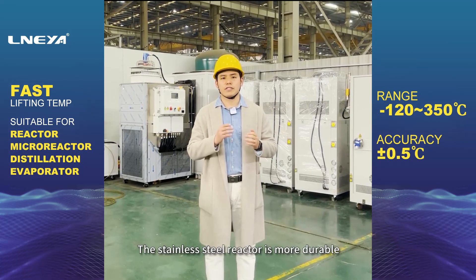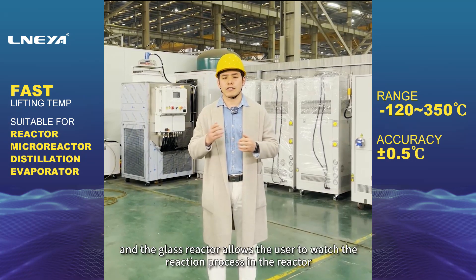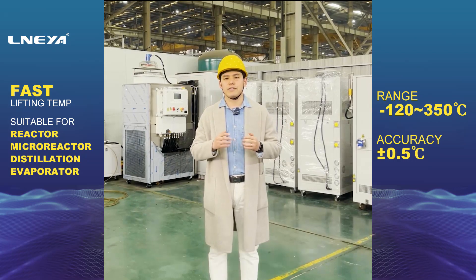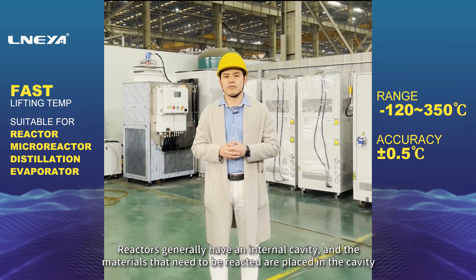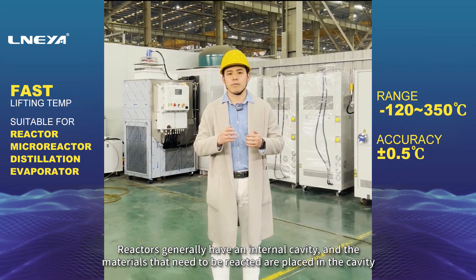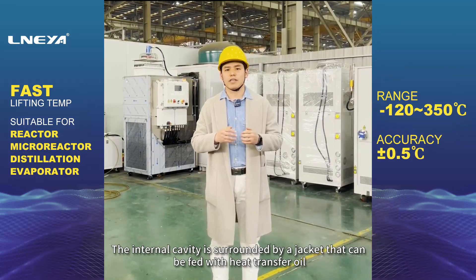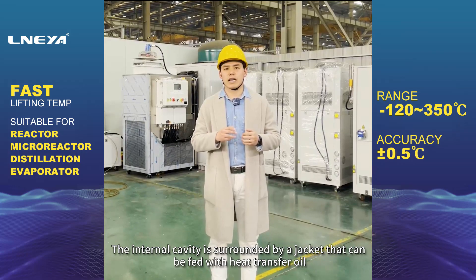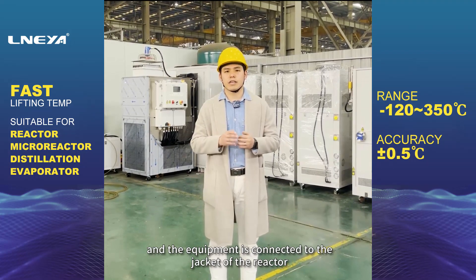The stainless steel reactor is more durable, and the glass reactor allows the user to watch the reaction process in the reactor. Reactors generally have an internal cavity, and the materials that need to be reacted are placed in the cavity. The internal cavity is surrounded by a jacket that can be fed with heat transfer oil, and the equipment is connected to the jacket of the reactor.